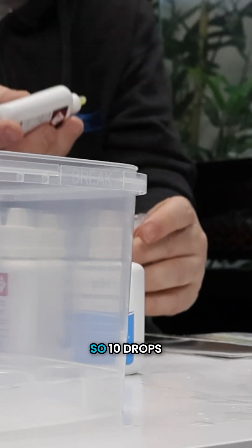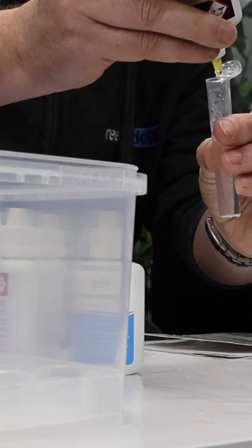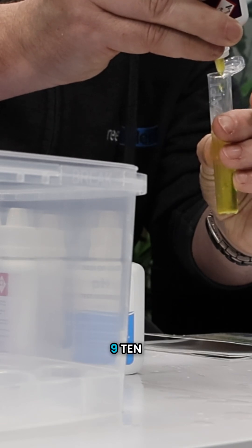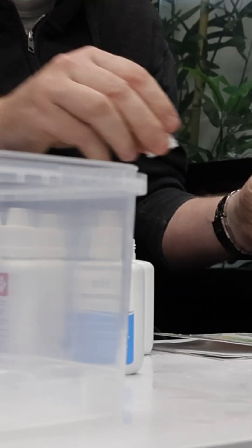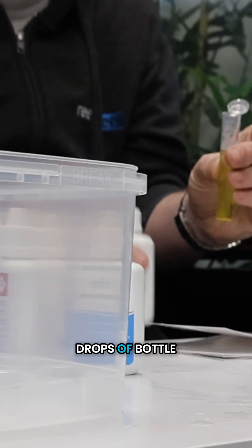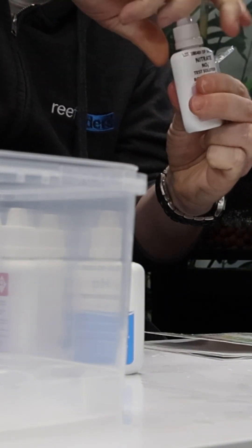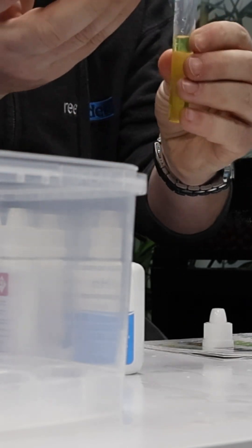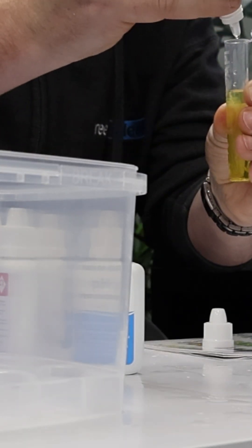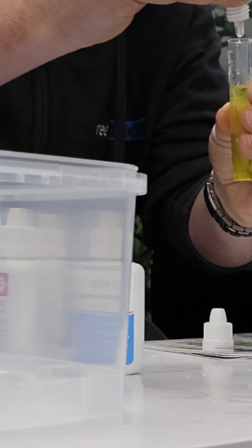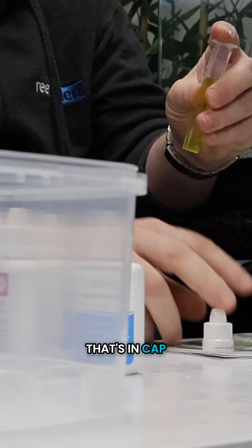Nine, ten, followed by 10 drops of bottle two. Cap on, give it a shake.